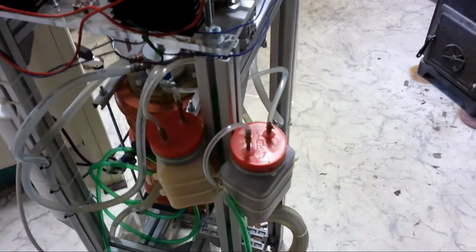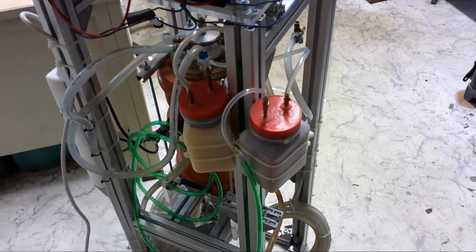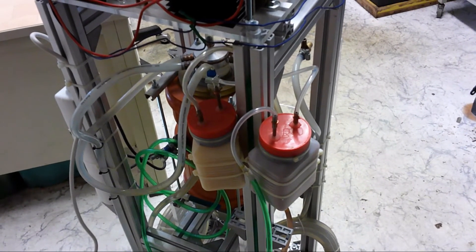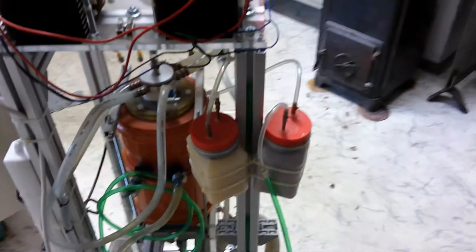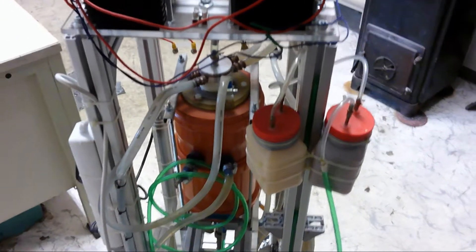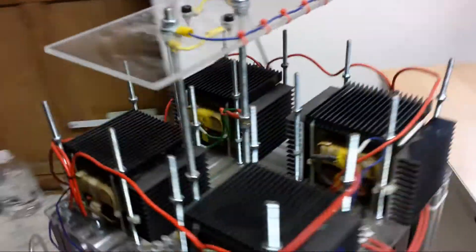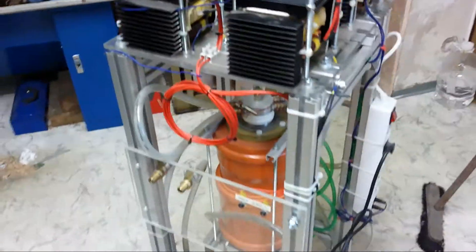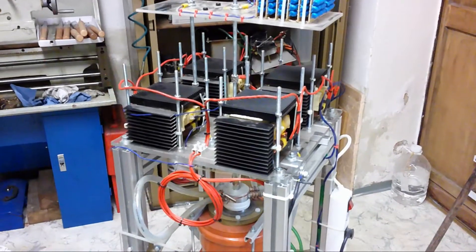These kind of flasks contain silica gel to dry the air that is blown into it. But I am not sure if I will use them again. I think it will pretty much work also with common air that is not dried. So let's get things started and disassemble the whole thing.